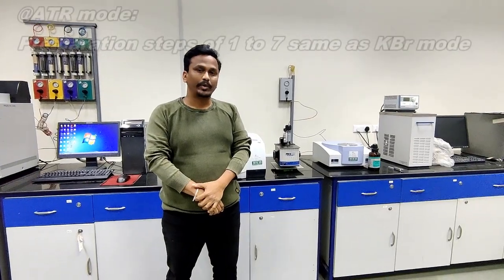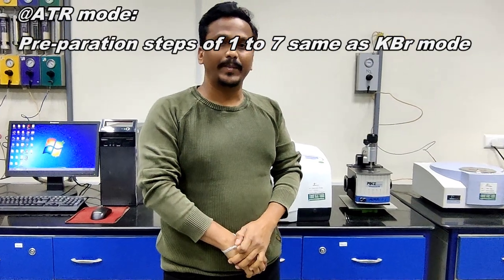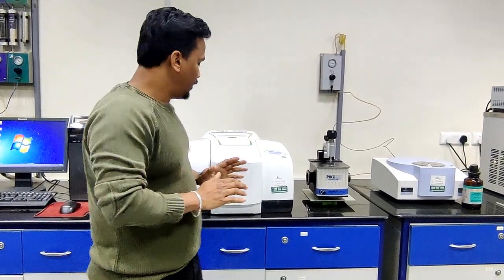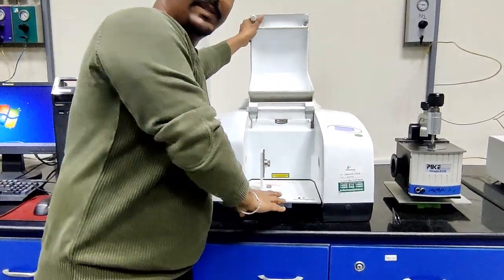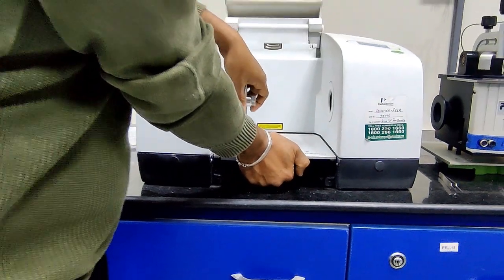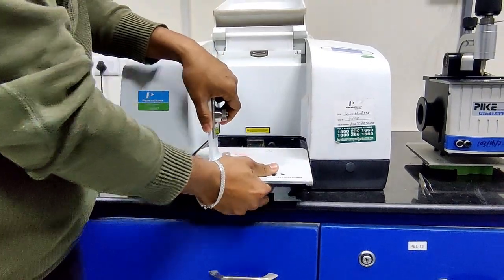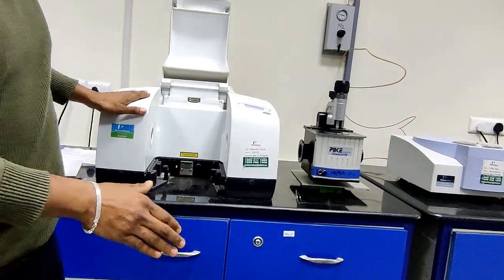I'll now explain how you measure the sample through ATR mode. The preparation steps for KBr and ATR mode, steps number 1 to 7, are completely the same. There is no change in ATR mode. Before doing sample measurement, we have to take out this KBr slide holder. Just press down on this and slightly pull. So it is open.